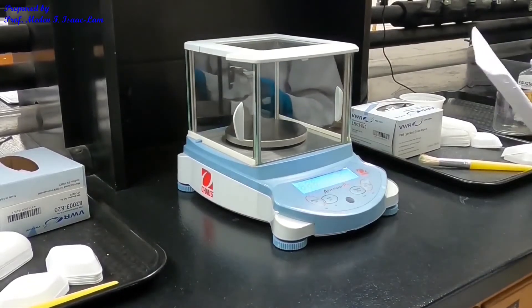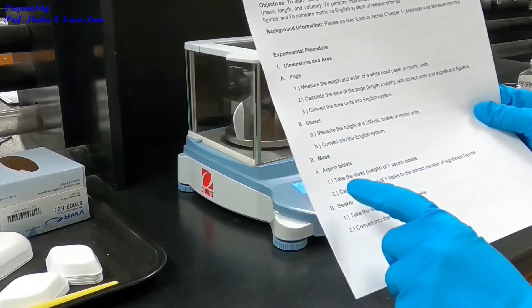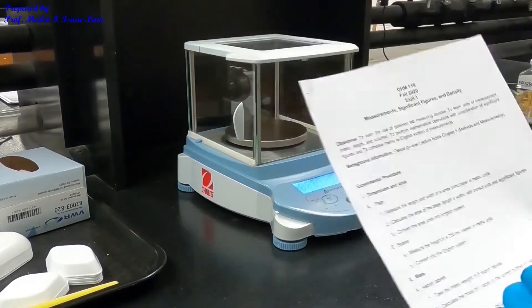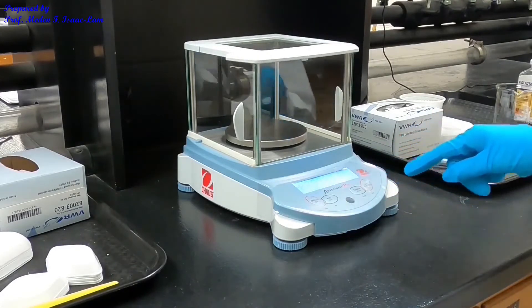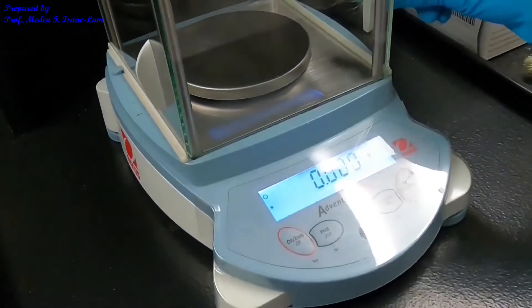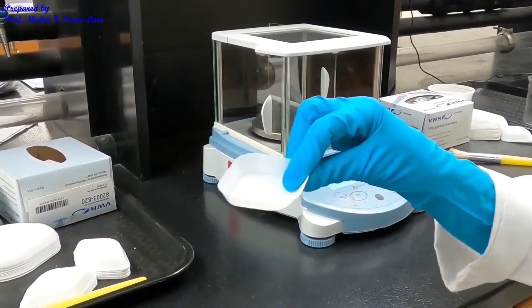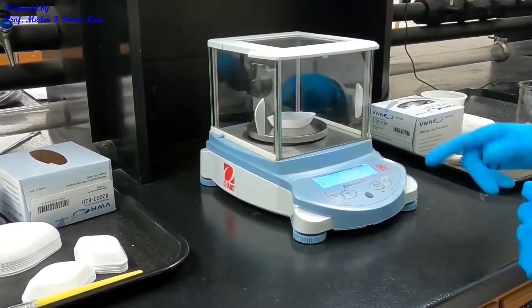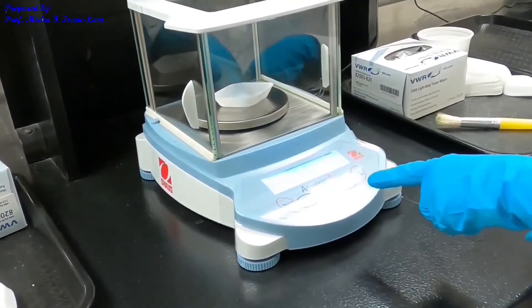We're now doing part 2, which is the mass. I'm going to measure the aspirin tablets as part A and the beaker as part B. This is the balance, and it's at 0. I'm going to put a weighing boat inside — it registers a weight — but since I don't want the weight of the boat, I'll zero it out. I press 0 and it's back to 0.